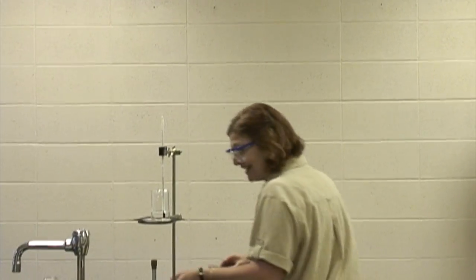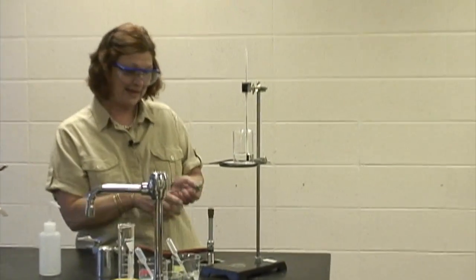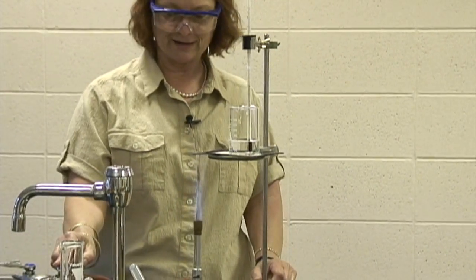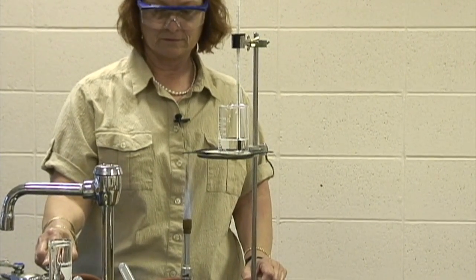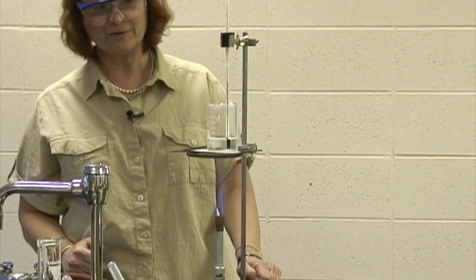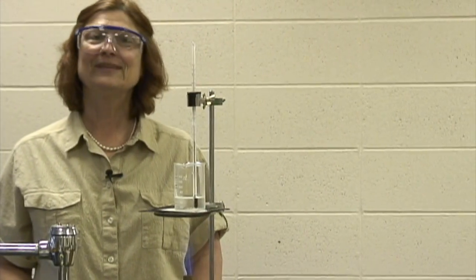Well, here we go. I'm going to light that Bunsen burner, turn on the gas, and give it some spark. It just didn't want to light right away. So I'm going to turn it down a little bit. And I'm going to go ahead and heat this water to the boiling point. And I'll be right back.